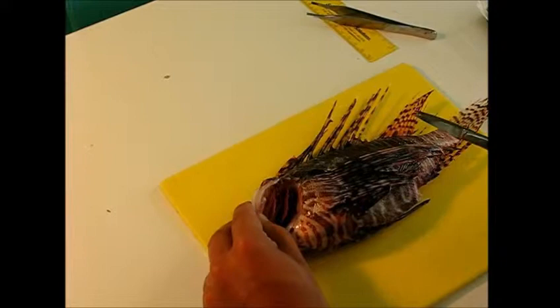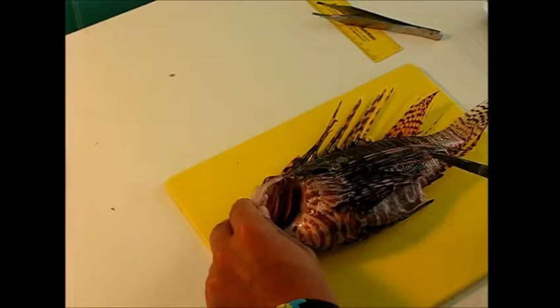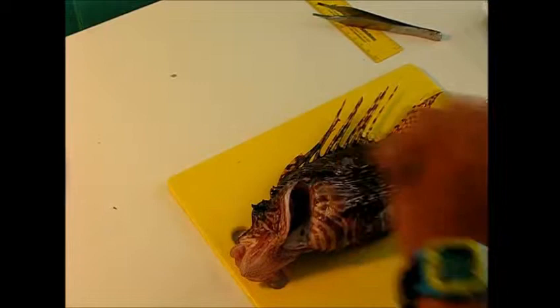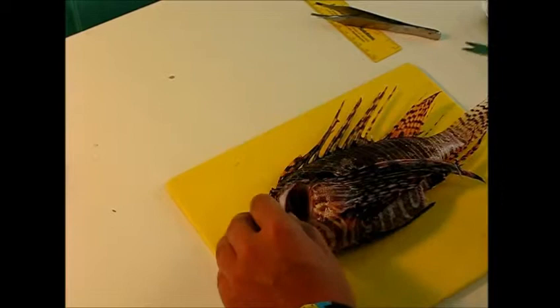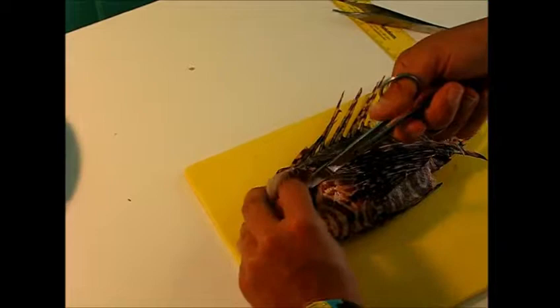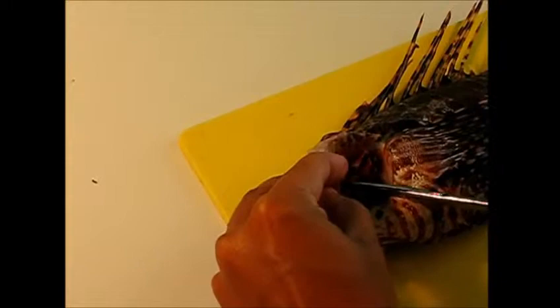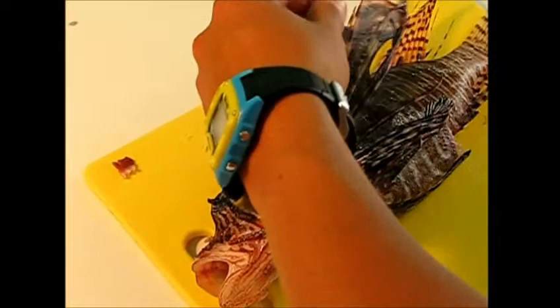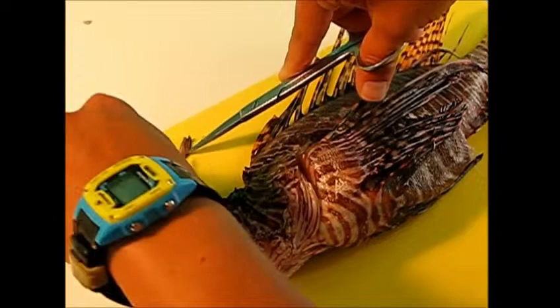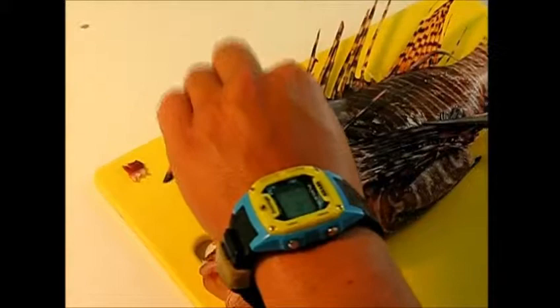Next I'm going to take some tissues for genetic sampling — three different tissue types: a sample of gill, a fin clip, and some muscle tissue. It's very important to clean your instruments with isopropyl alcohol to make sure they are not contaminated between samples. To get the gills, you open it up and cut out a one centimeter sample. For the fin clipping, you can take it from the pectoral fin. And then muscle tissue can just be taken from the flesh.